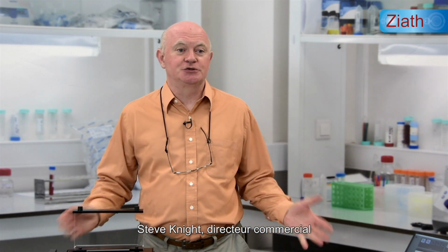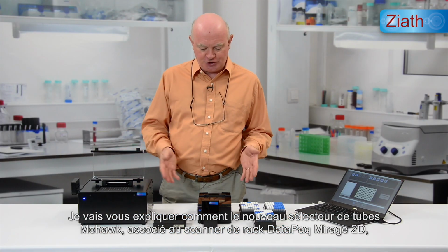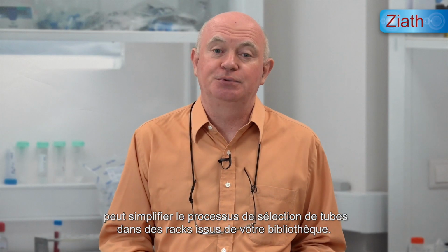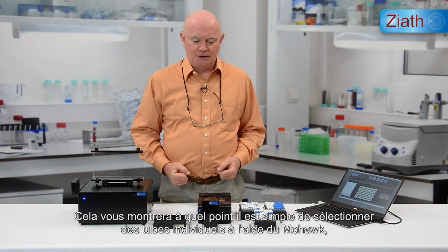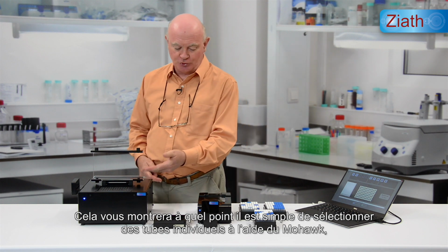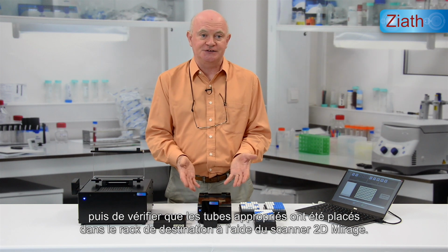I'm Steve Knight, Commercial Director, and in this short video I'm going to explain how the new Mohawk tube selector, working in conjunction with the DataPaq Mirage 2D rack scanner, can simplify the process of selecting tubes from racks which have come from your library. You'll see how easy it is to select individual tubes using the Mohawk and then to verify that the correct tubes have been picked to the destination rack using the Mirage 2D scanner.